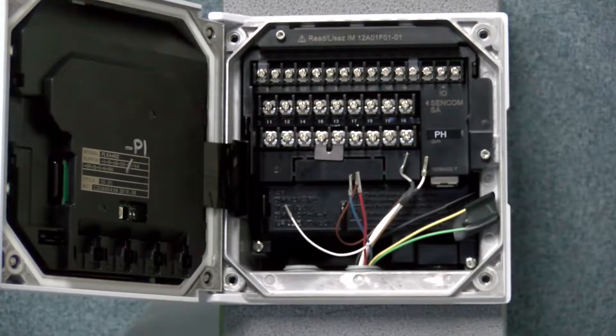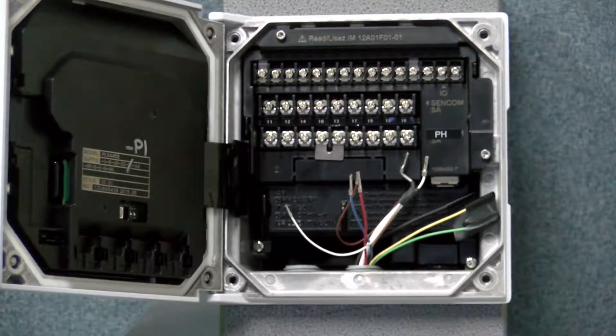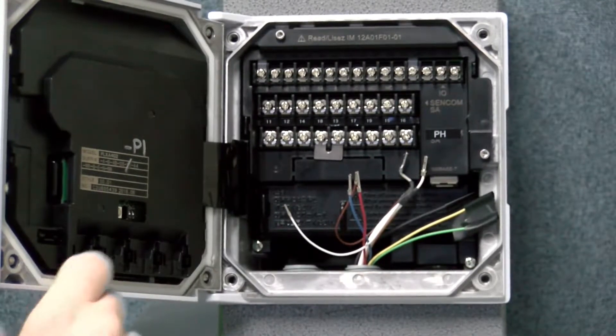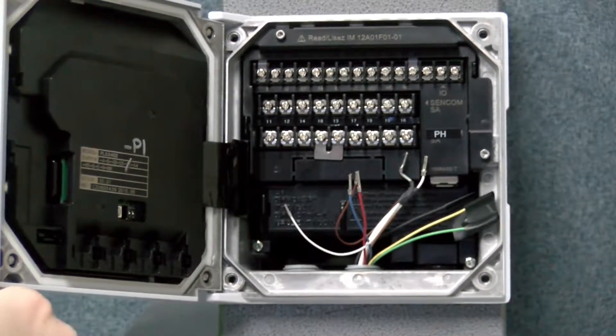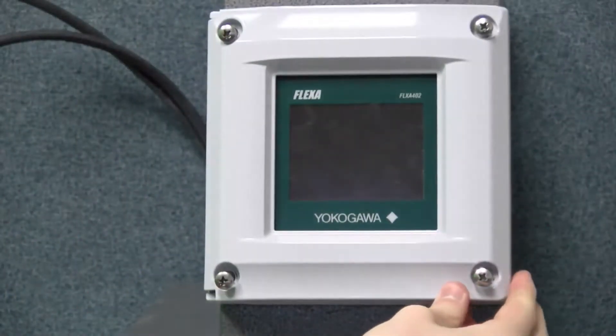Hello, my name is Tyler Ballou from Yokogawa, and today I will be showing you how to wire up a pH sensor to the new Flexa 402.